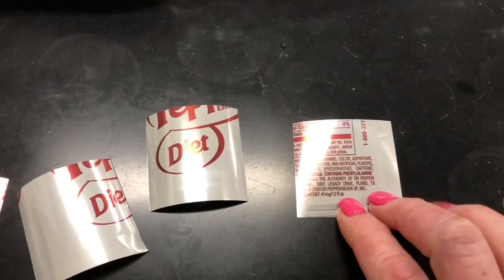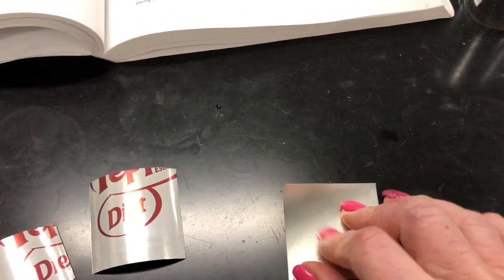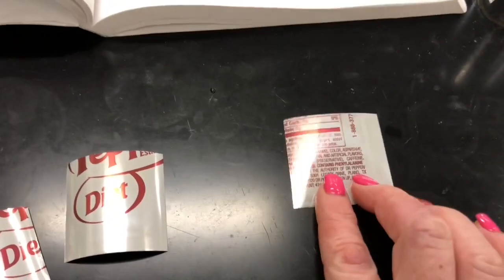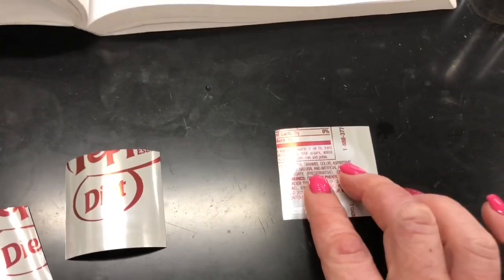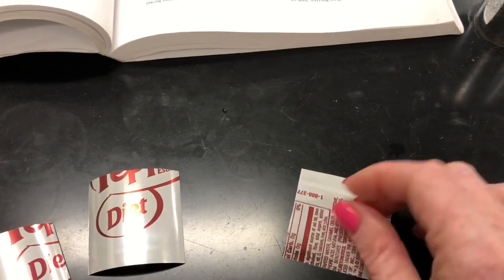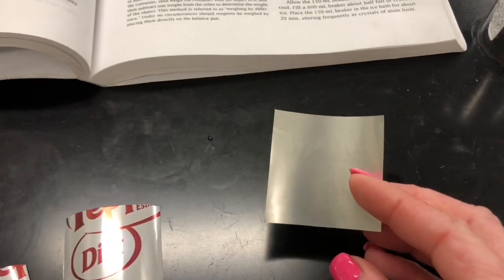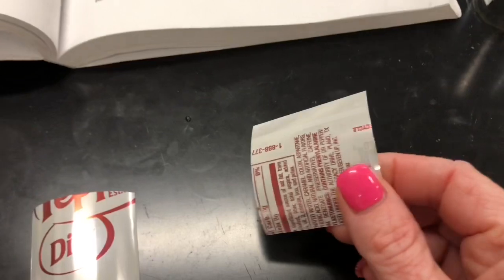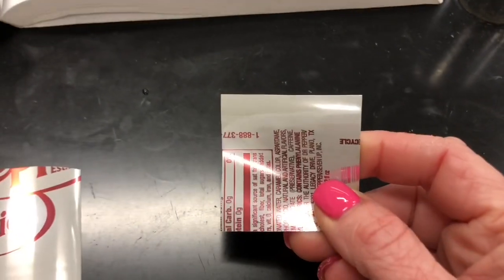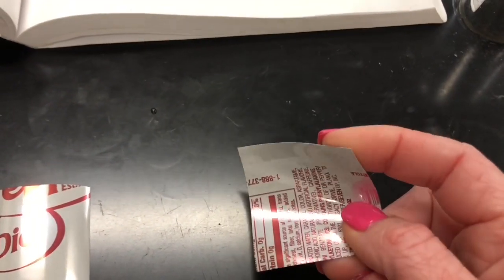What I'm going to do next is use some steel wool to take off the paint and the plasticky coating on the inside, just get it down to aluminum. Then I'm going to cut these into little tiny squares and add them to my potassium hydroxide — it happens to be 1.4 molar, but it could be a different concentration and a different amount.